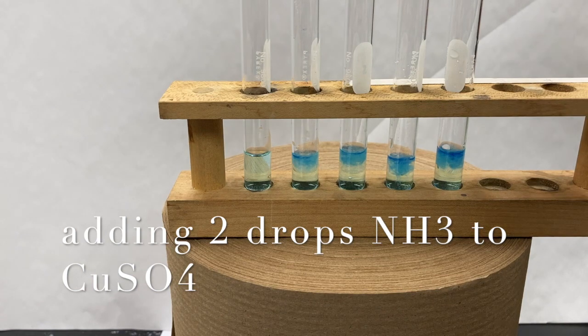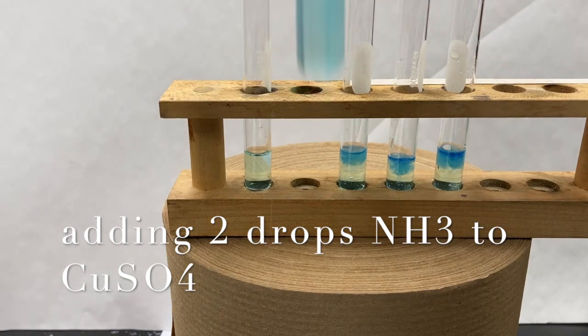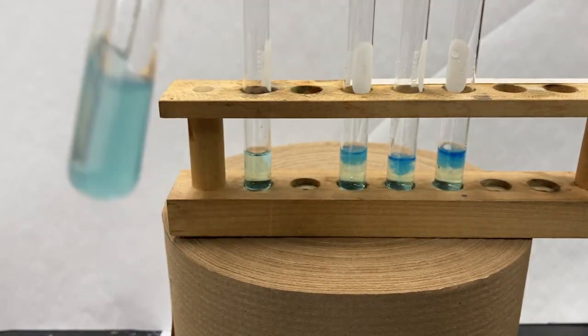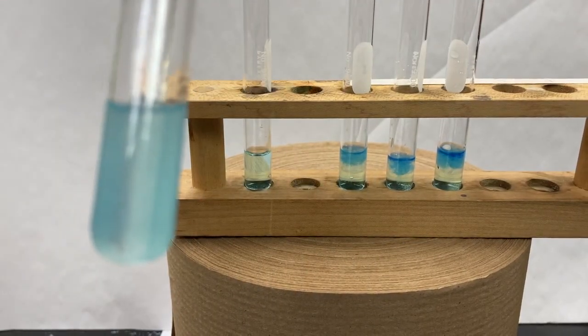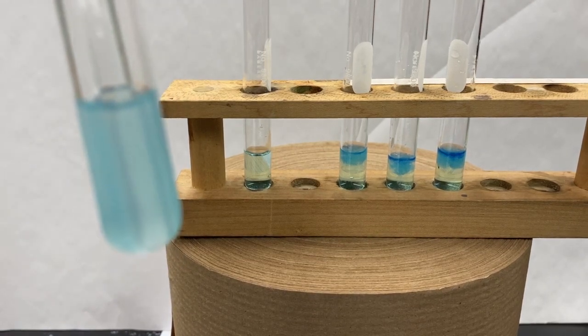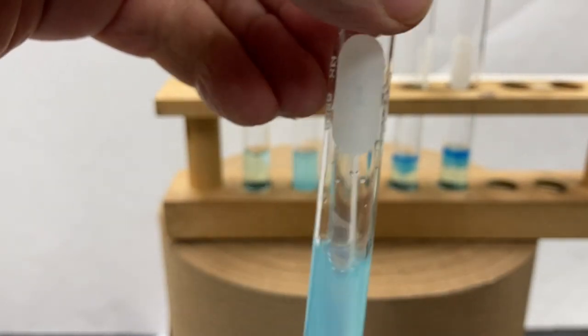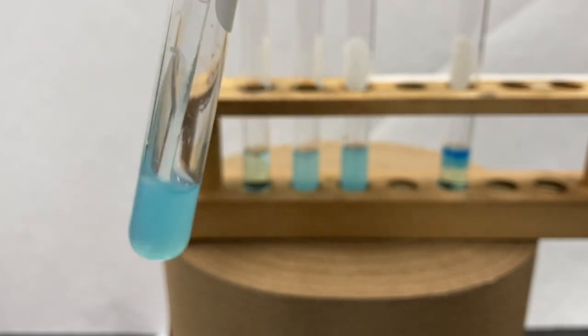So initially we get some cloudiness. And to each of these tubes that I added the ammonia to, we're getting the same cloudiness initially.